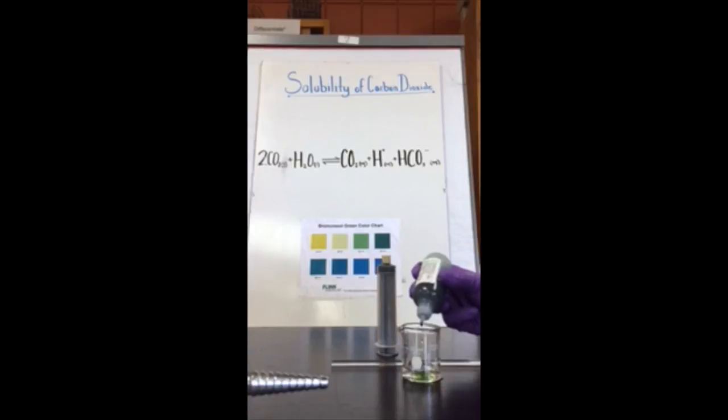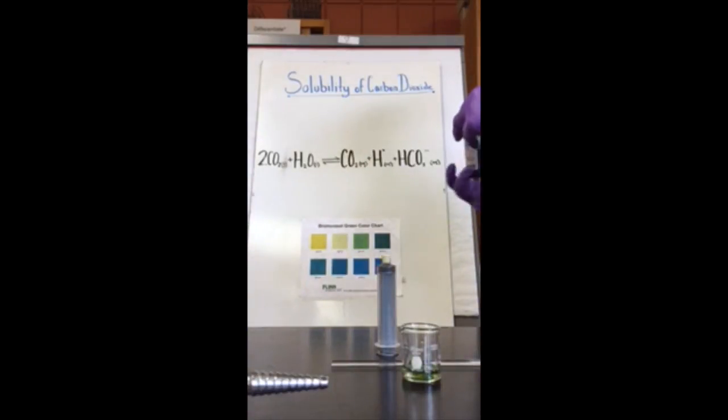One, 2, 3, 4, 5, 6, 7, 8, 9, 10, 11, 12, 13, 14, 15, 16, 17, 18, 19, 20. Now we're going to stir it.